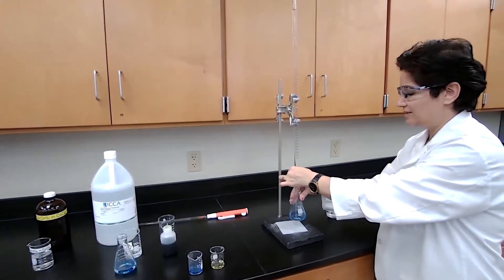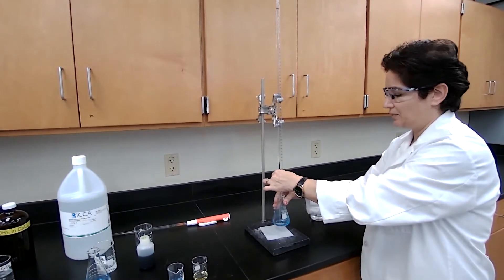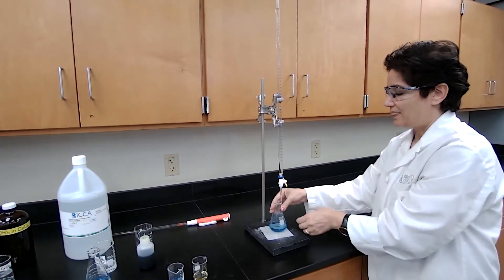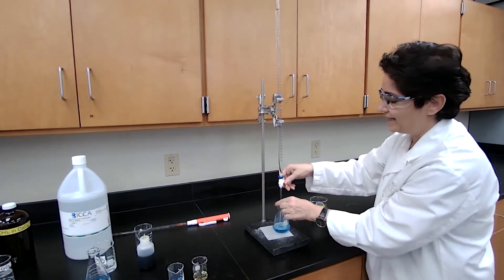Just like other titrations, at the beginning I can add probably faster and then I get slow. I add slower.